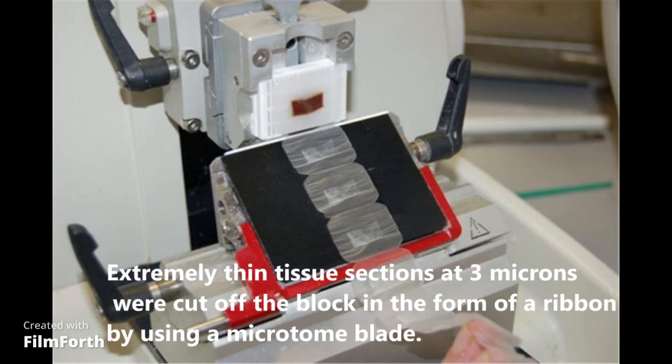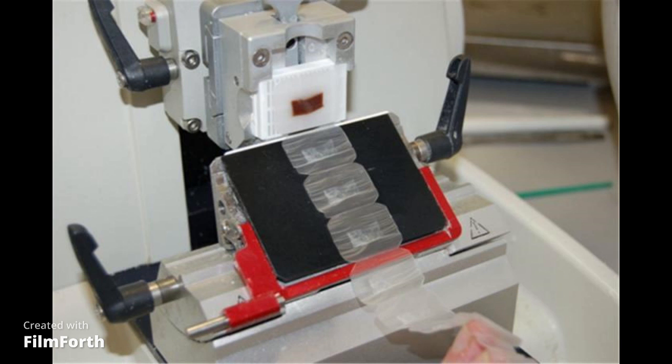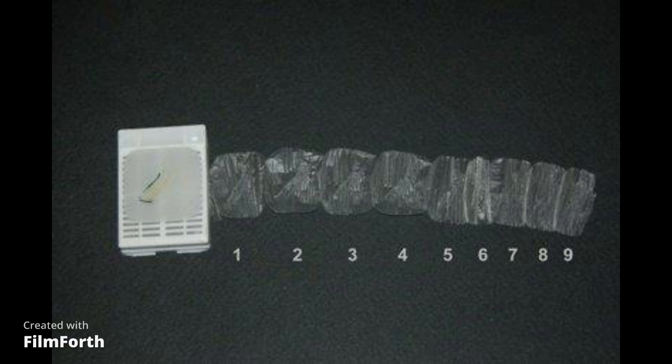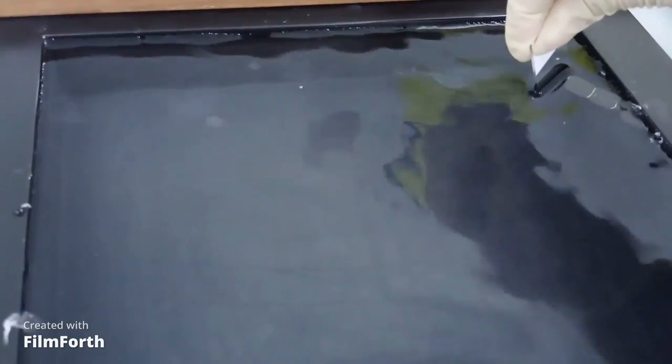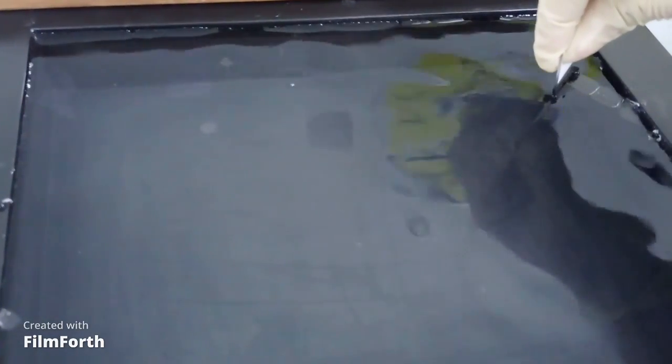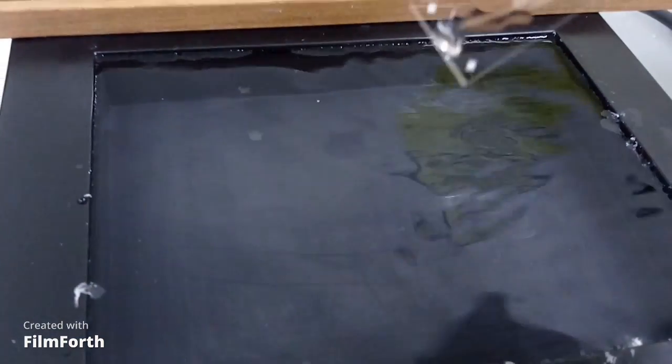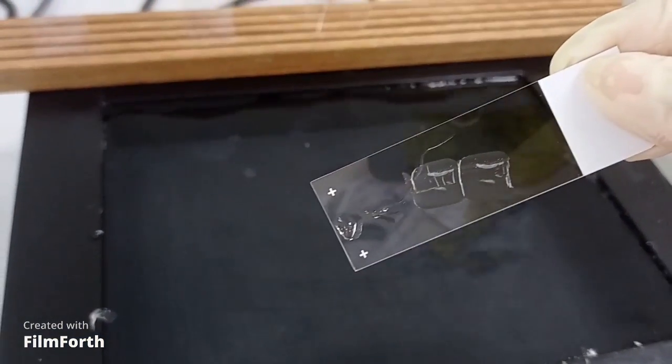After getting microsections of breast cancer tissues, I am putting these microsections on the floating bath and then fishing these microsections of breast cancer tissues onto the slides.